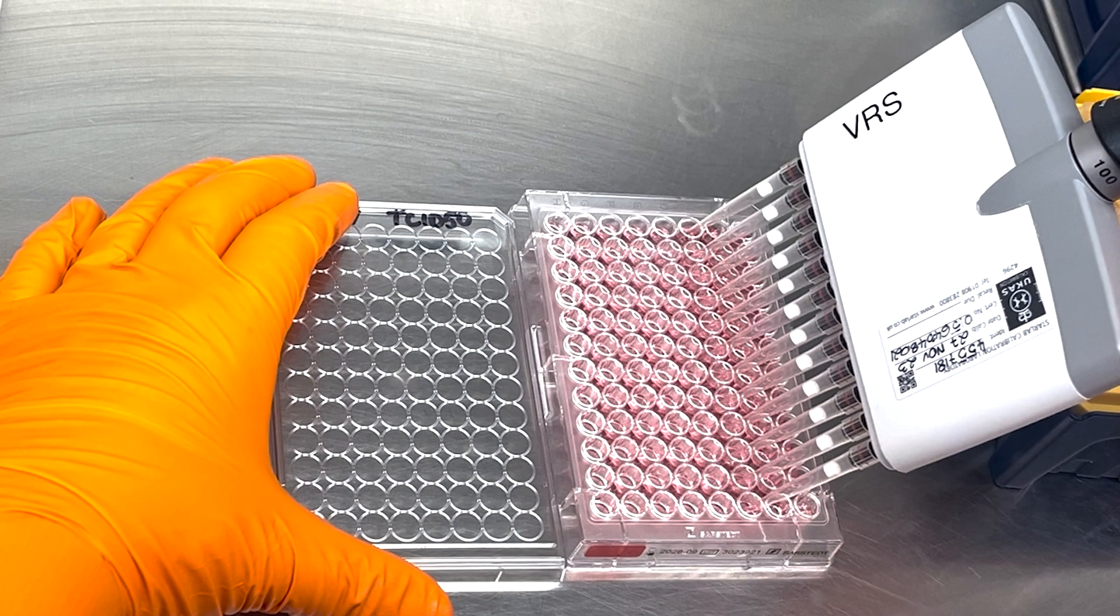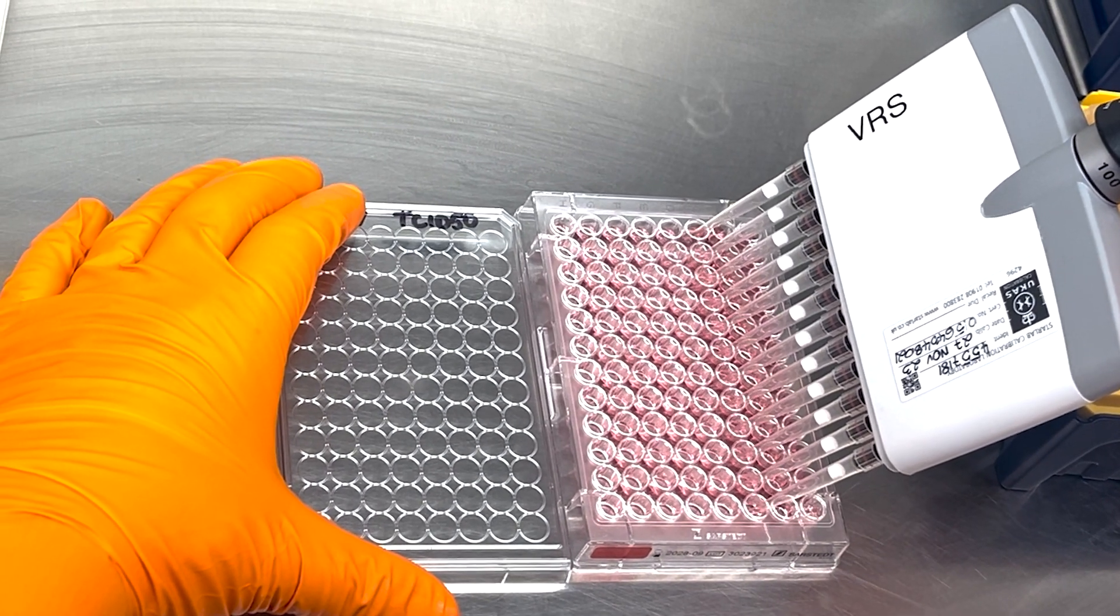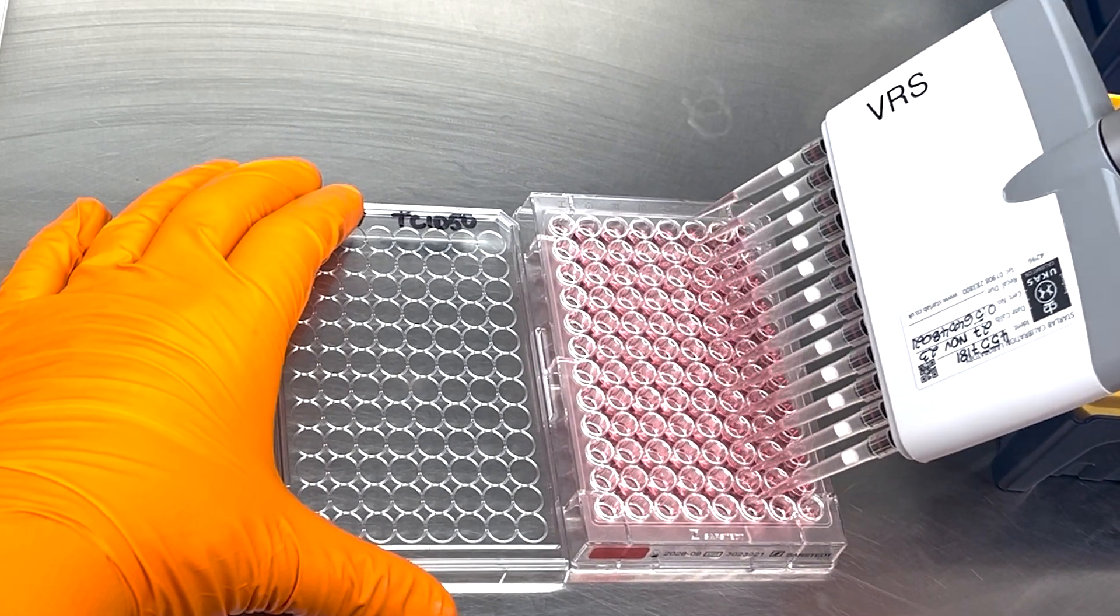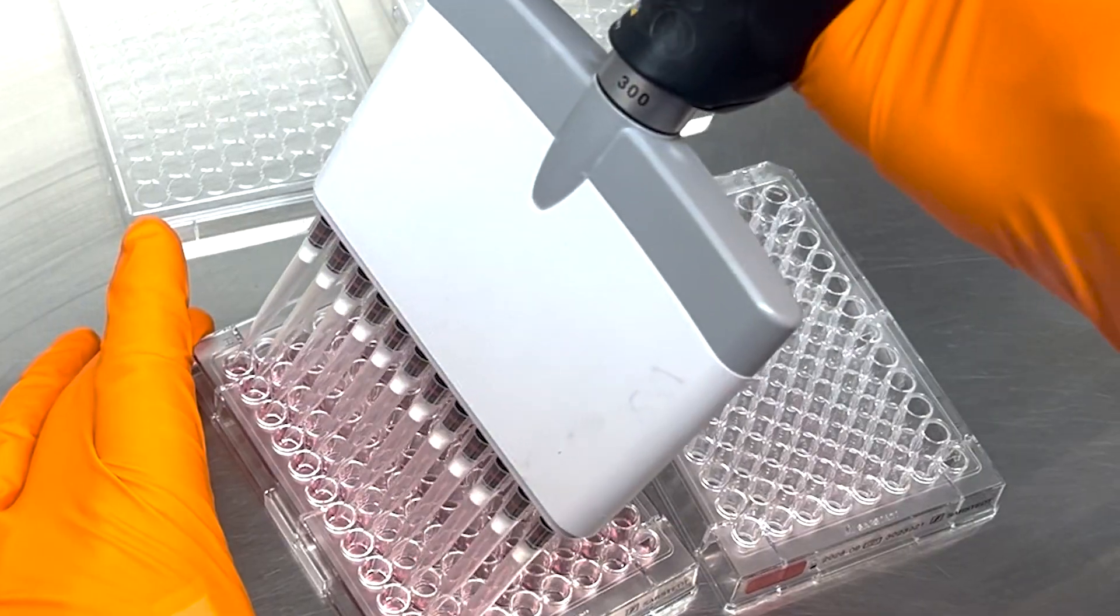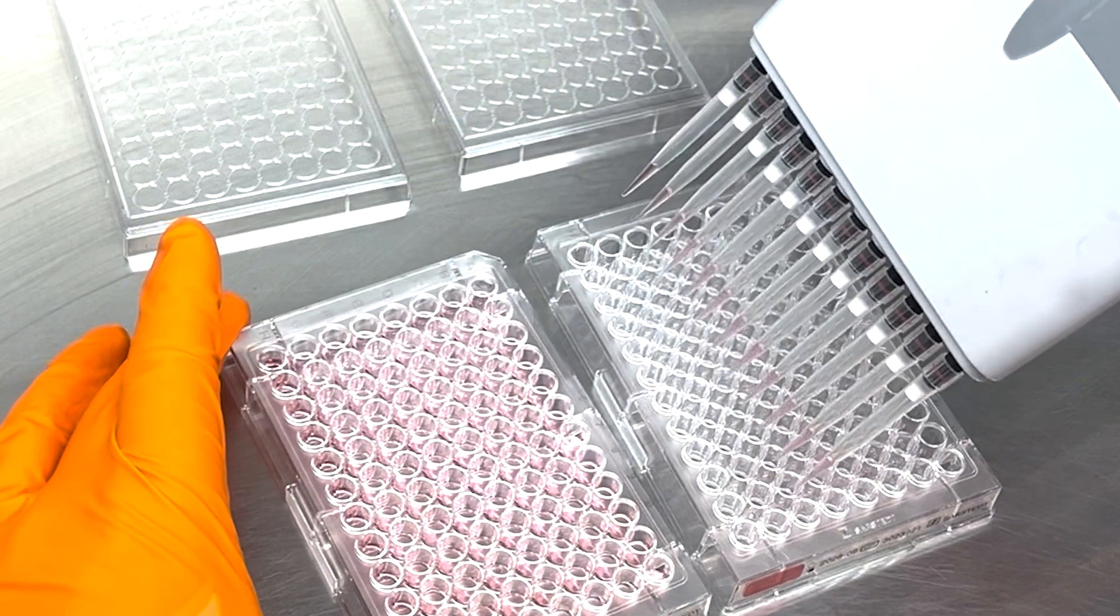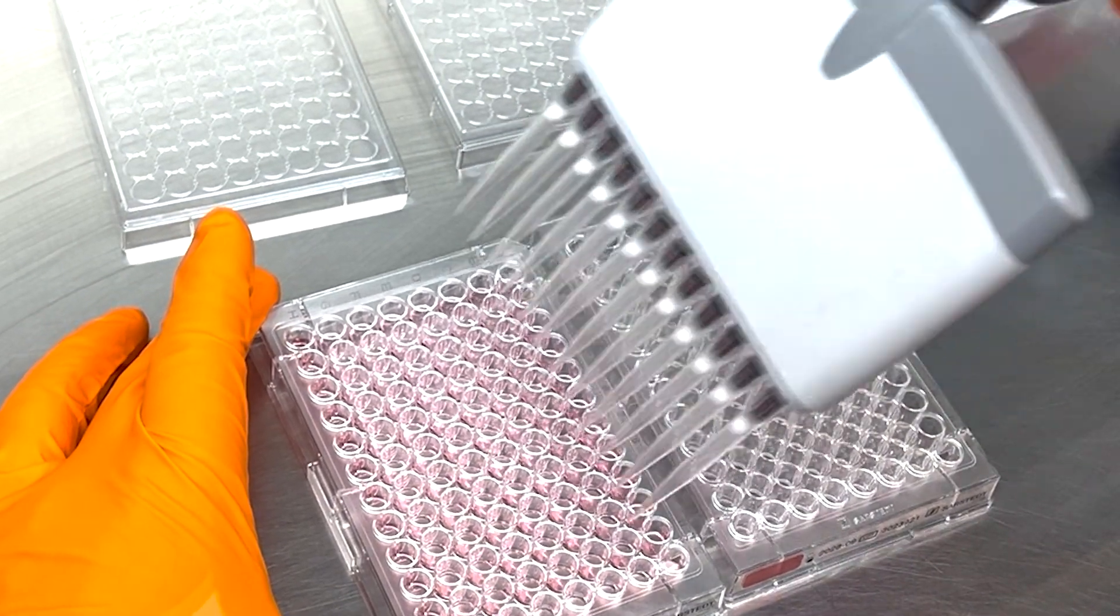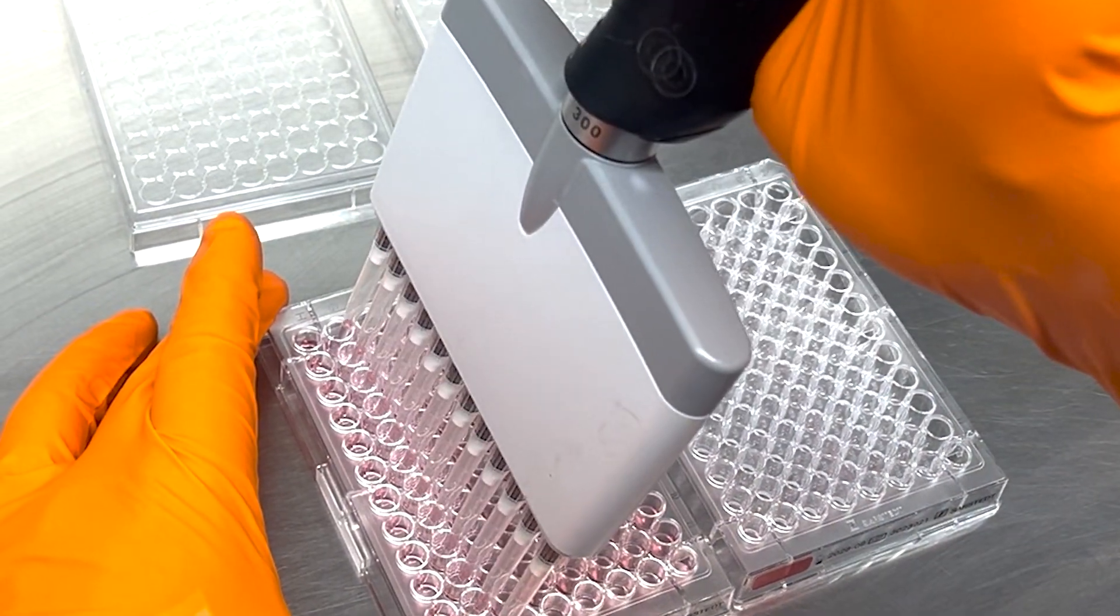Next, we inoculate these dilutions onto cells that were seeded the previous day and are currently being incubated. We then carefully transfer the virus dilutions from the bottom of the dilution plate down to the corresponding wells on the cells plate.